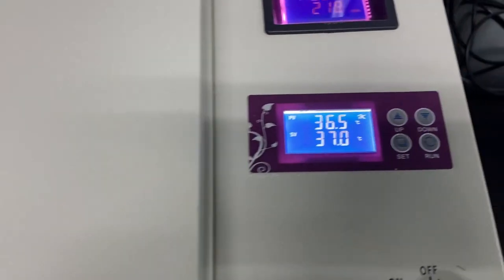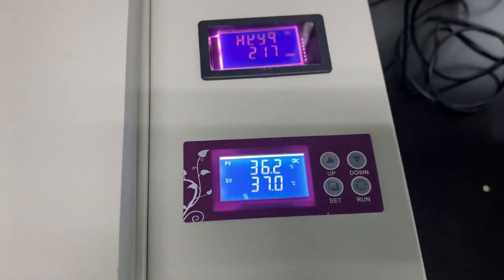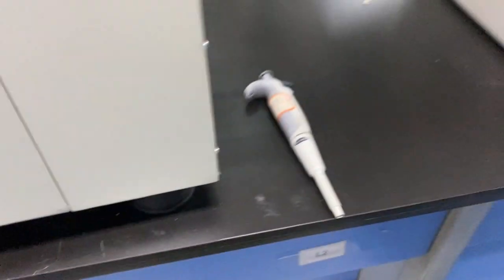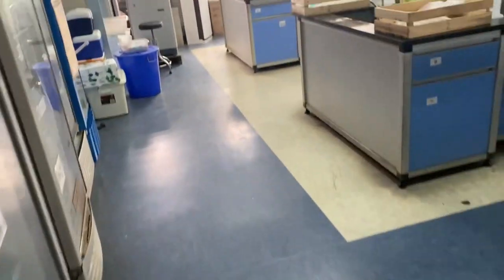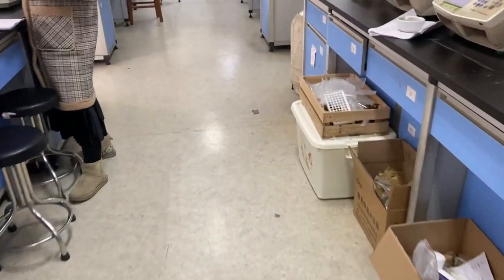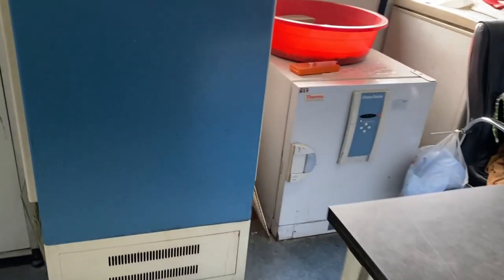After culturing the media in LB, you can transfer it to the centrifuge. Centrifugation of one minute would be enough to get a pellet. The pellet dissolved in LB media can be placed on Petri dishes, and those Petri dishes can be kept at 37 degrees Celsius.